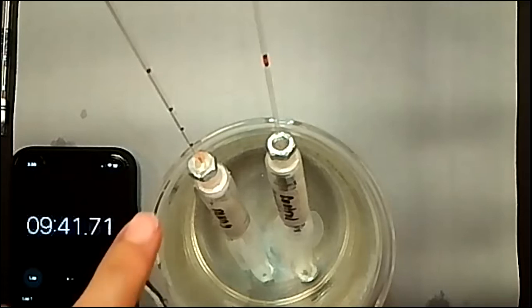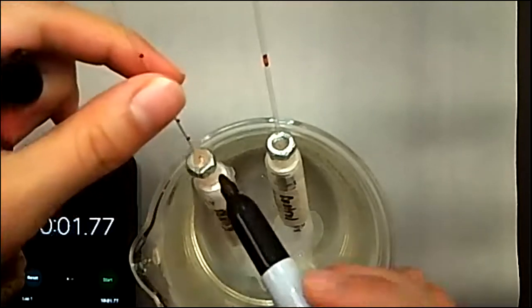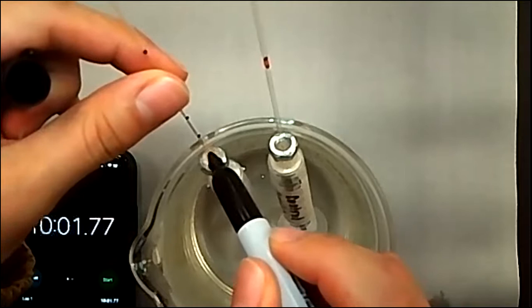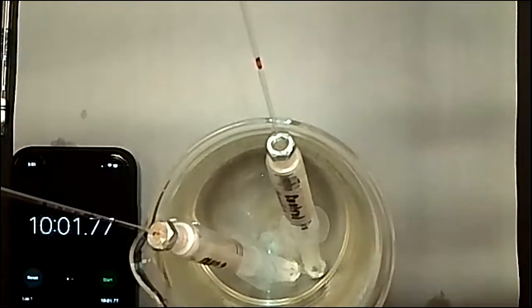And as you can see, the liquid is pretty much moving into the actual end of the capillary and into the syringe, which means it will get absorbed up by the cotton inside. And we will just mark the distance as the base of the capillary at 10 minutes, which we are about to come up to. And that is 10 minutes. So I will just mark it as the base of the capillary, since that is the last point where we can actually see and record. And then obviously the one on the control didn't really change.